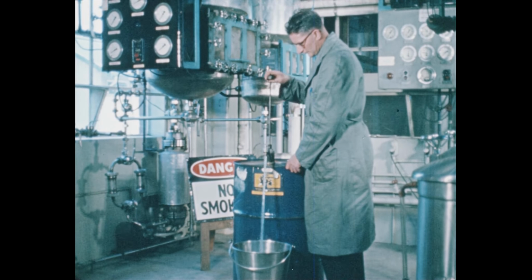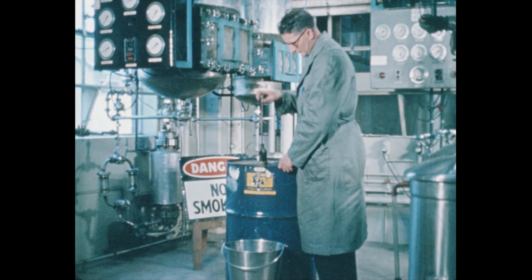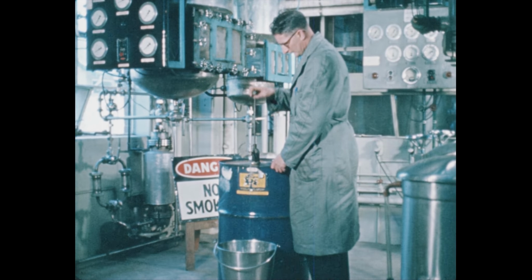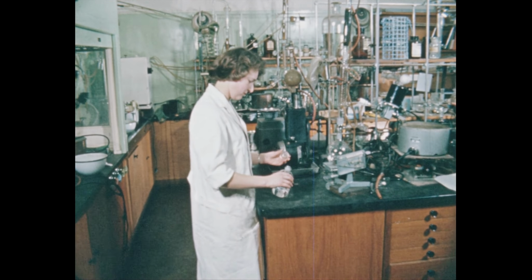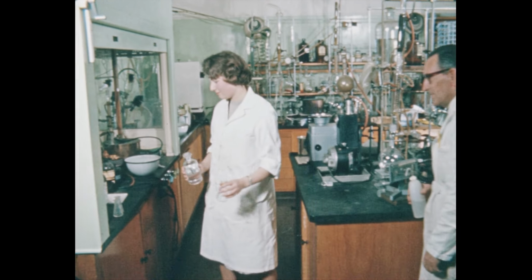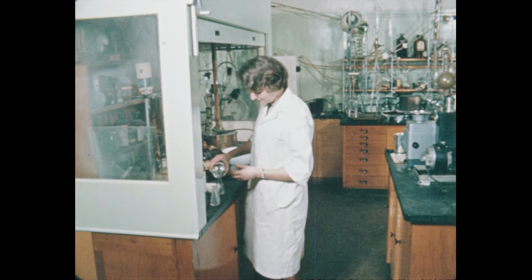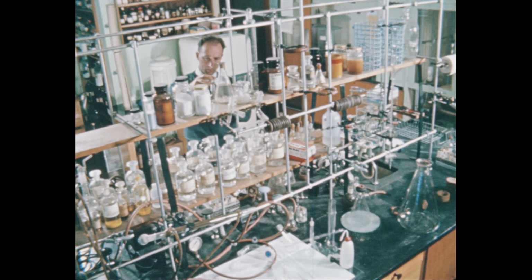Don't worry, this isn't benzene, because no one could be quite so stupid as to handle it like this. Handling large quantities of benzene greatly increases the danger of vapor escaping into the air you breathe. Carelessness in the handling of benzene can have damaging results for others as well as yourself. But you can still cut these risks down further by working well inside the fume cupboard, not on the edge.